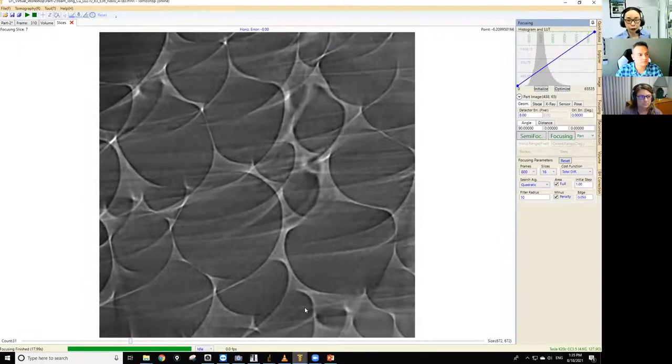You might see the sample movement effect as streaking lines, either horizontal or vertical lines if you do a 0 to 180 degree scan. If you do a 0 to 360 degree scan, you probably don't see those streaks in one direction, but if you scan, let's say, a cylinder, you will see the cylinder cross section and you see another one bigger. When you have that doubled image, that's another sign that your sample was moving. So you can tell, and you probably want to be looking for the sign of sample movement if you know that the sample is not too rigid and might have moved during the scan.